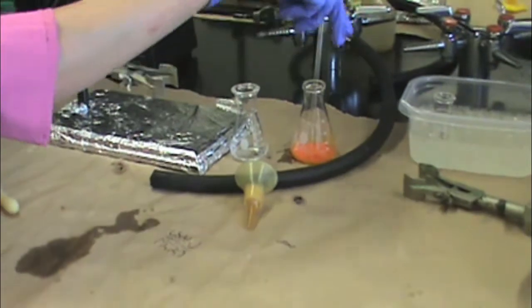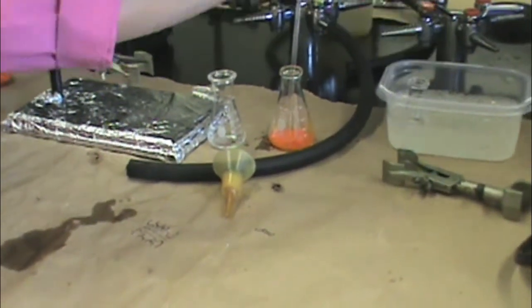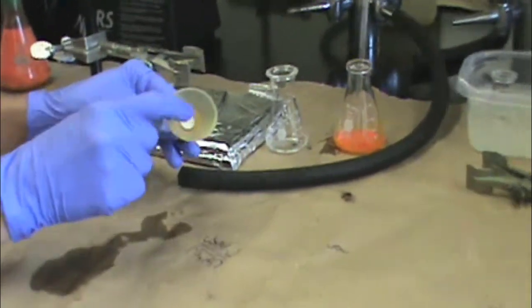the crystals that you have recrystallized, your recrystallization solvent chilling in ice, and your Hirsch funnel, making sure that you have a little white disc in the Hirsch funnel.